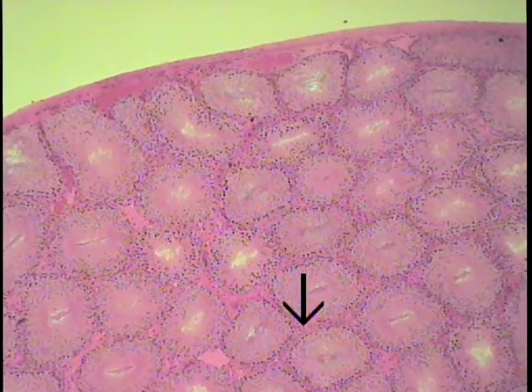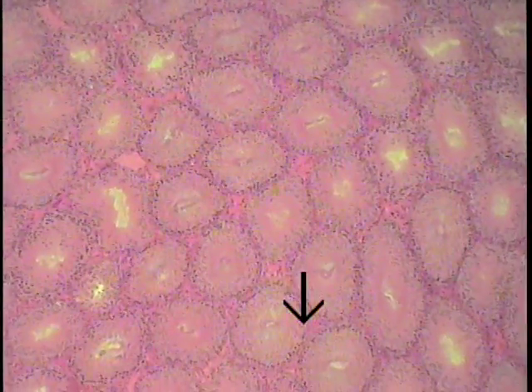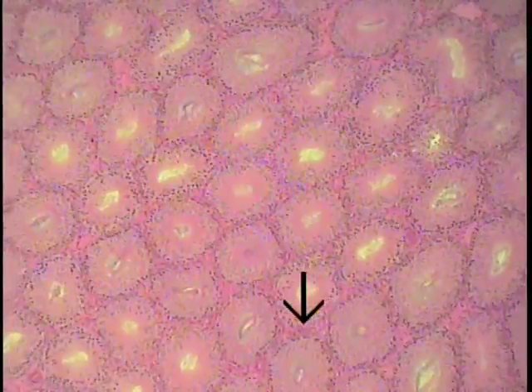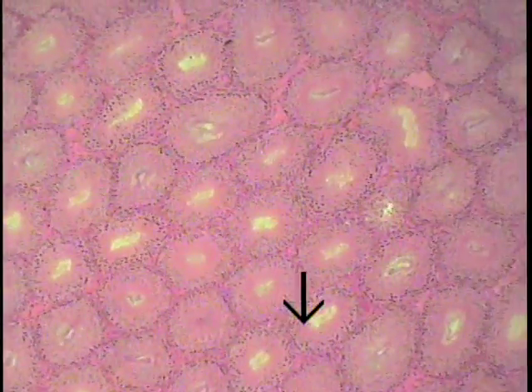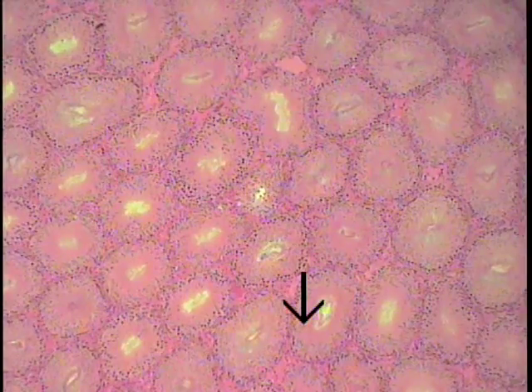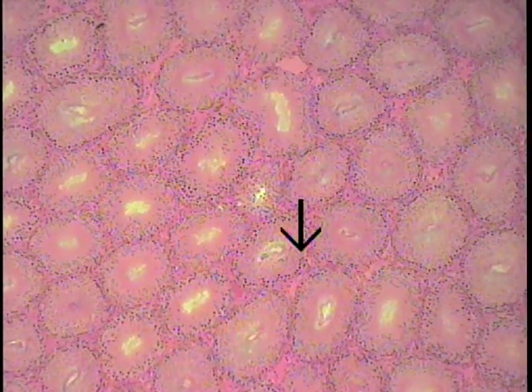This particular cell type produces the hormone testosterone for the male. And if one moves the field, one can see numerous seminiferous tubules cut in cross section. This scenario — seminiferous tubules surrounded by the delicate interstitial tissue — repeats itself over and over again. Having scanned the field with the low power objective, then go to a higher power objective and examine a seminiferous tubule and the interstitial tissue for various cell types.